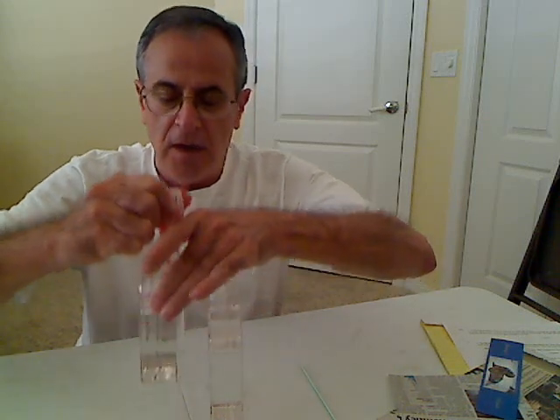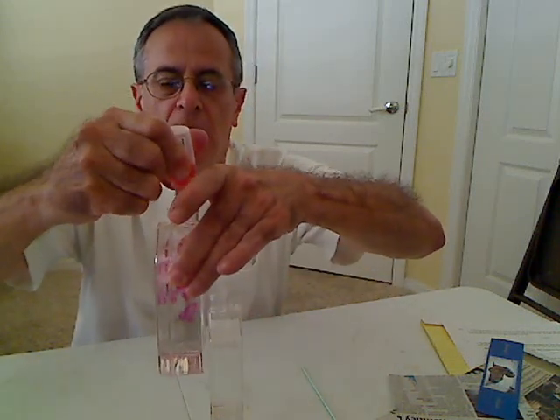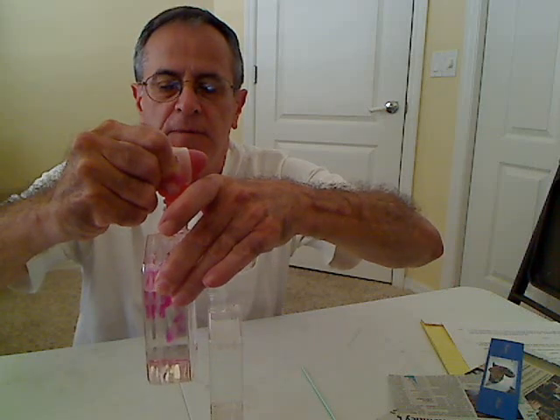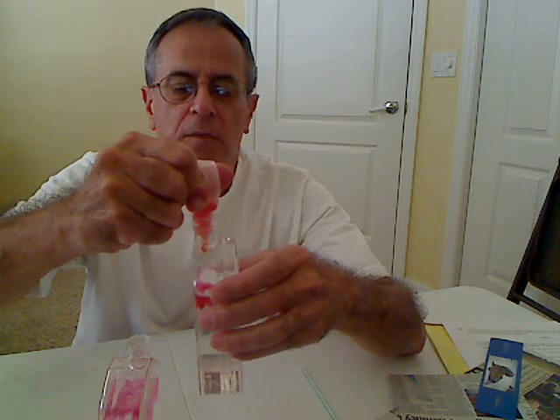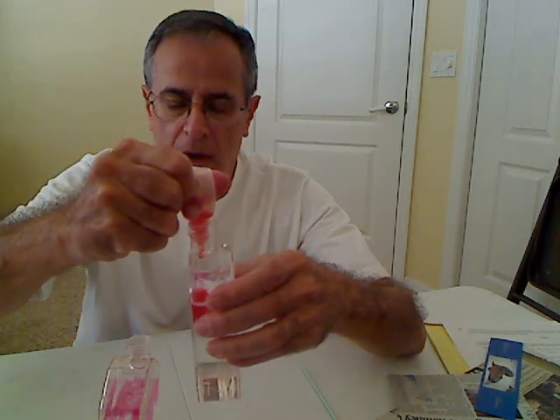This is a rather dilute indicator, so I'm going to put maybe five or six, maybe ten or so drops in two containers. One will be the control, one will be the sample. They're about the same color, and I'm going to blow into one of them with my breath.